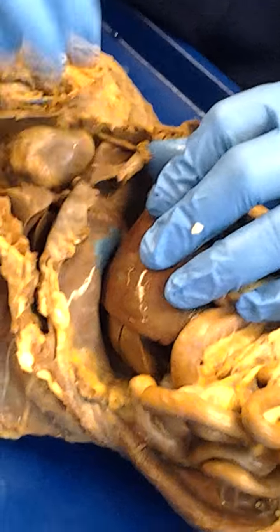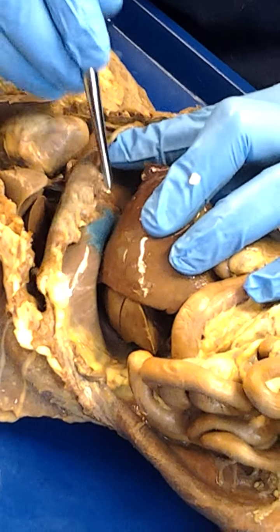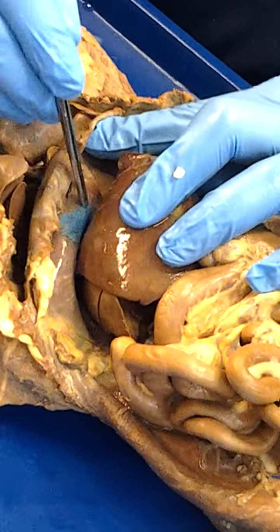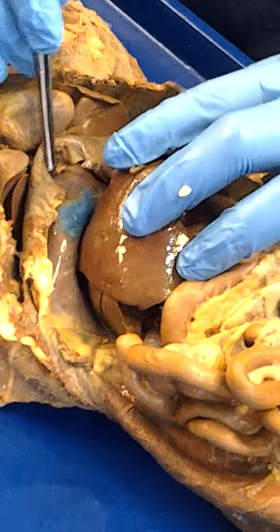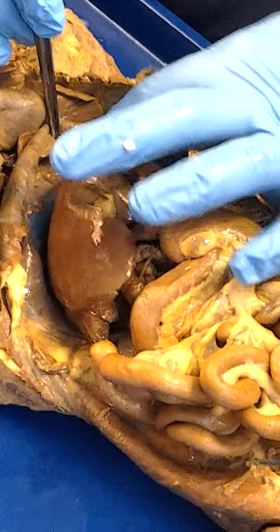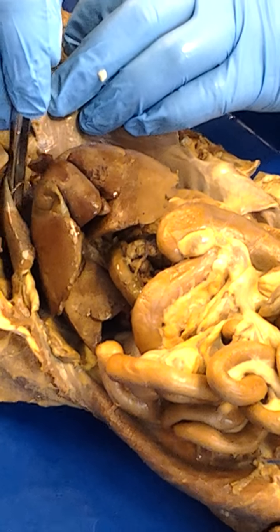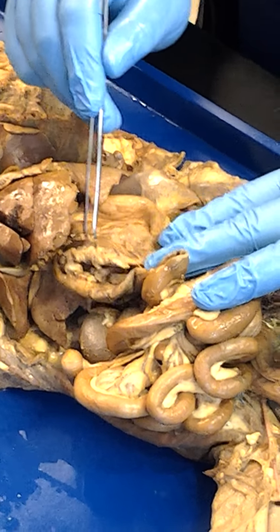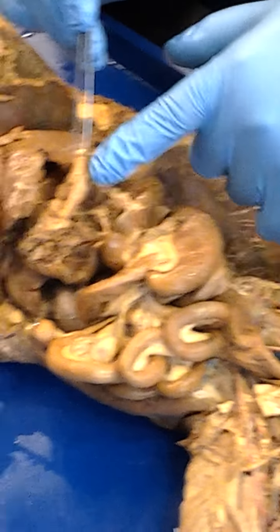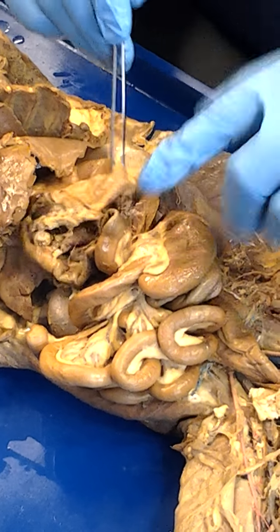Now, this is a terrible one. This one actually seems to be ruptured. But there's a venous blood vessel that would be on the underside of the diaphragm, right about in this position here where it's ruptured. And that, of course, would be the inferior phrenic vein that would have been underneath the diaphragm here. As we head downwards, we have a blood vessel on the top of the stomach here, which would be the gastric artery. And then down here at the bottom of the stomach, which would be the gastric epiploic.